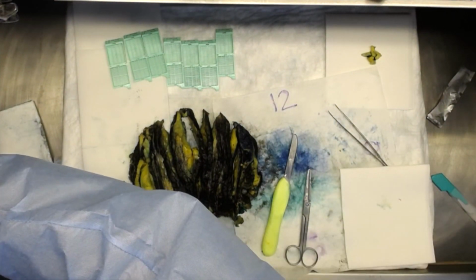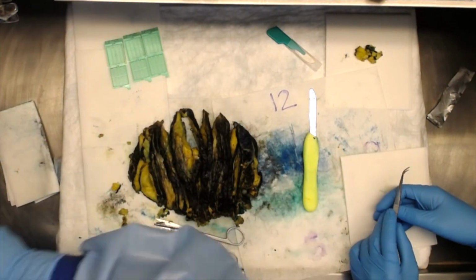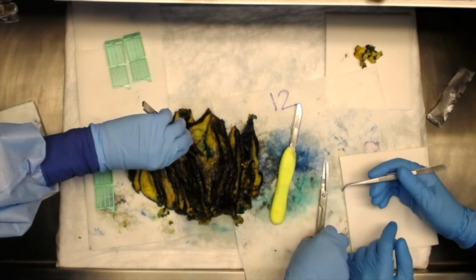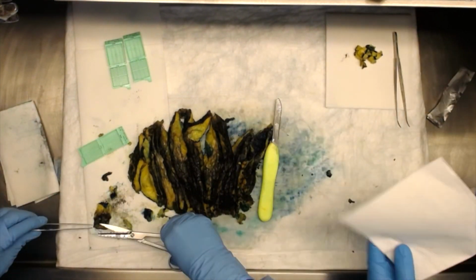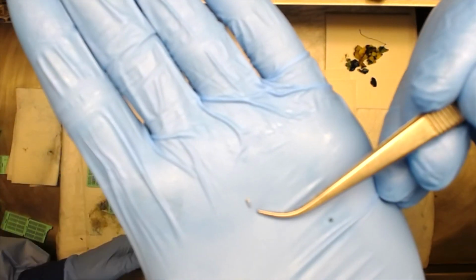For any 2 lesions, submit 1 section of breast tissue between these lesions. Submit 1 representative section from each quadrant of the breast and 1 from the central area of the breast. Remember to palpate the axillary tail and submit any possible lymph nodes. Remember to remove all biopsy clips from the tissue before submitting to histology.